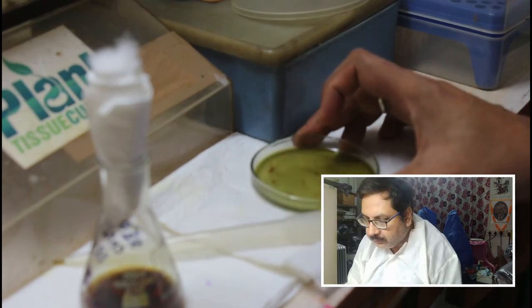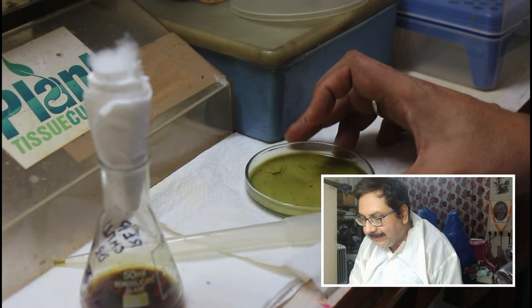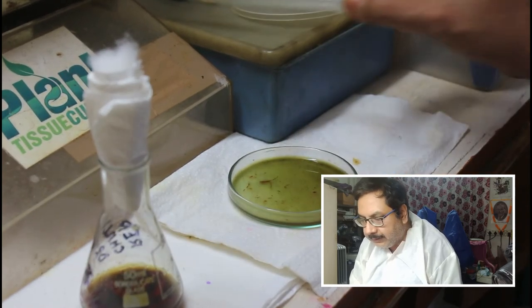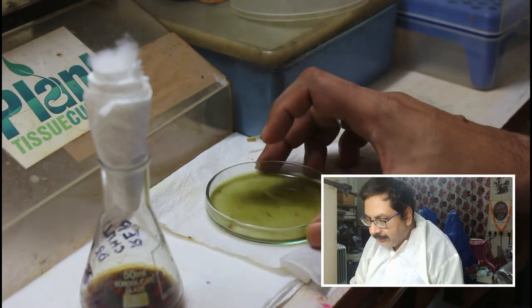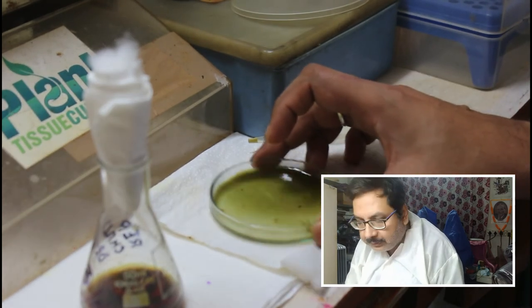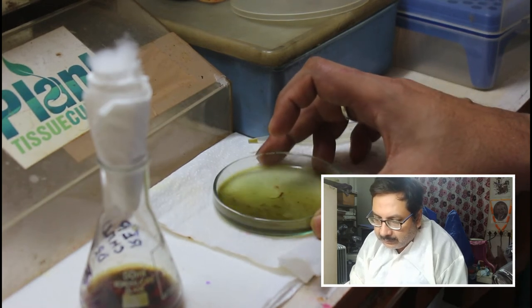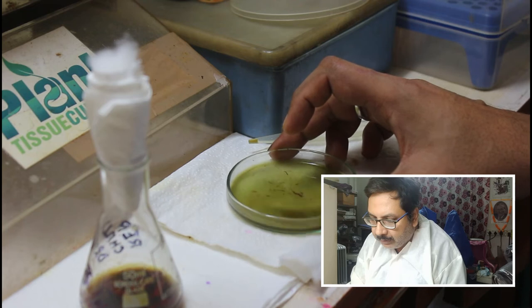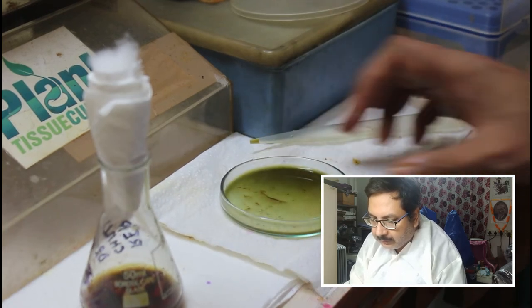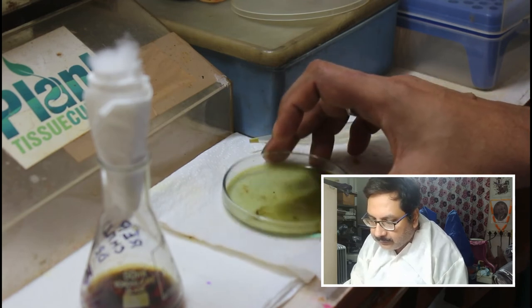The color has changed from reddish to greenish — the pH has actually changed the color in the culture media. As you can see in the camera, it is greenish in color and lots of funguses are there, almost visible to the naked eye. This is a mold fungus, and therefore it is visible to the naked eye.